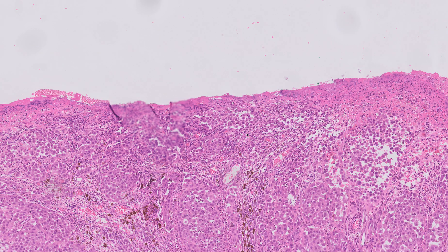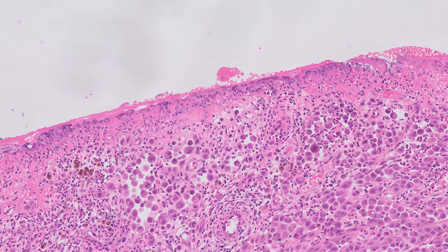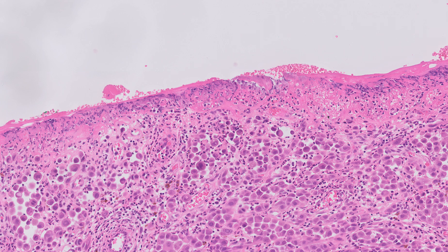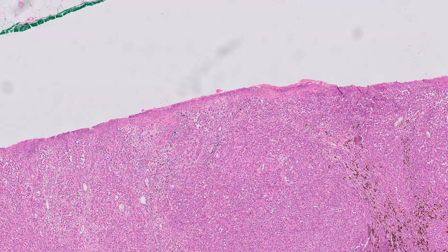The surface is extensively ulcerated, with complete loss of the epidermis and replacement by a fibrinous inflammatory exudate on the surface.